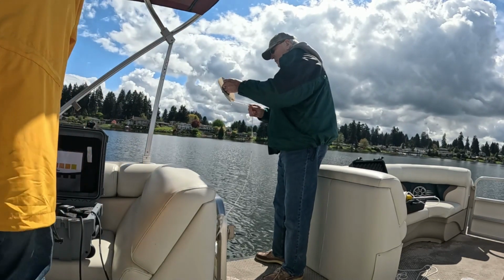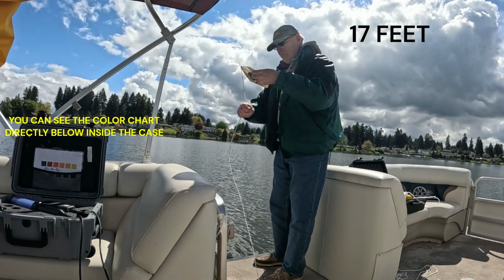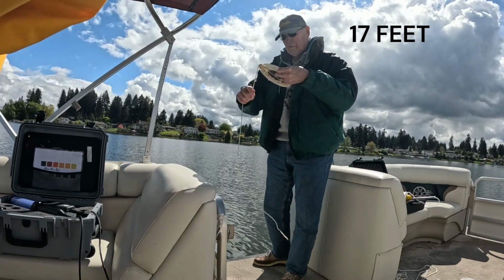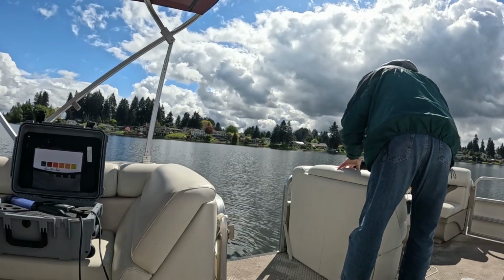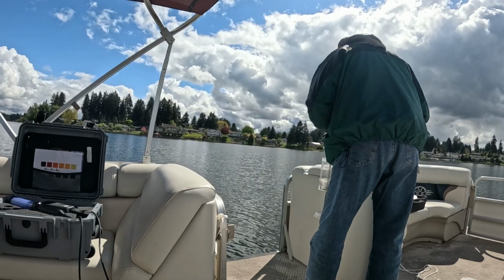And the bottom, right now we're showing at 17. That's 5.2 meters.